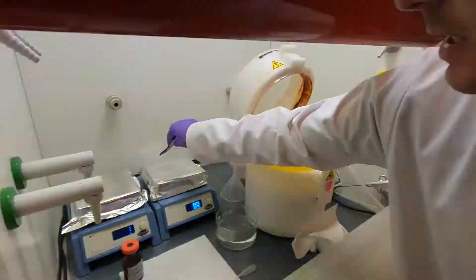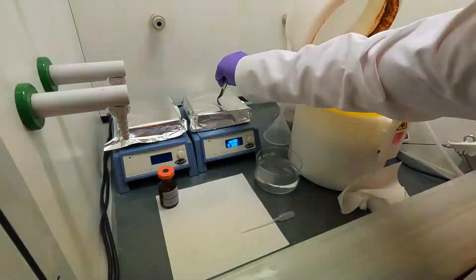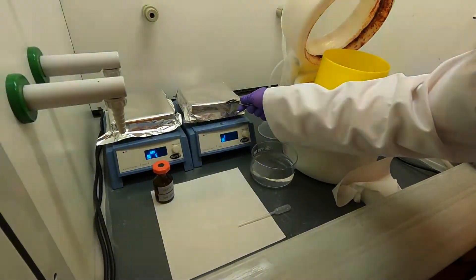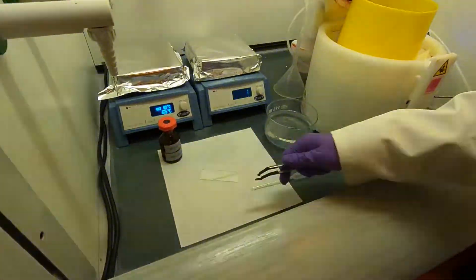I'm going to take this sample off the hot plate and leave it to cool down on a piece of paper, on a clean room wipe, for 90 seconds. I'm just going to leave it here.